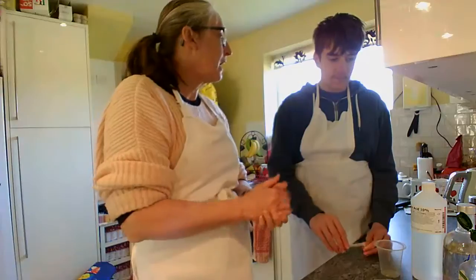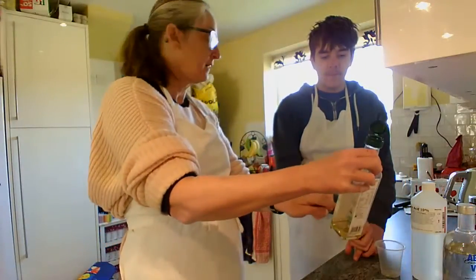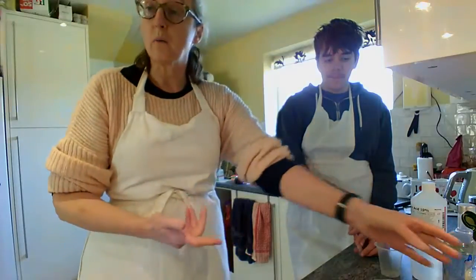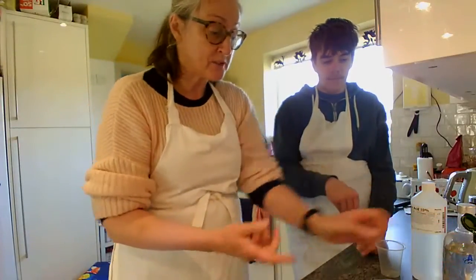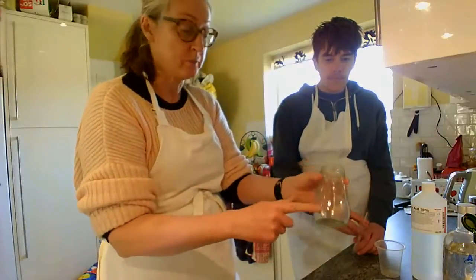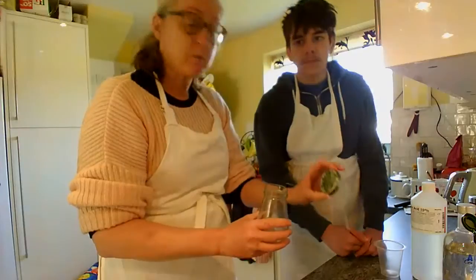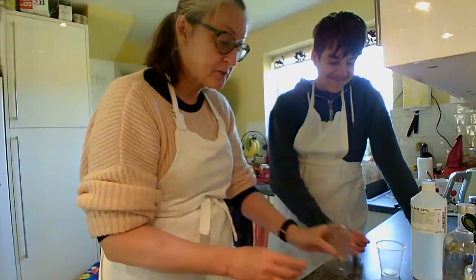And our carboxylic acid that we're using is ethanoic acid, which is obviously vinegar. We're using white wine vinegar. We haven't got much of it left, as you can see, so we're somewhat limited by that. This is our conical flask, as you know from past videos that we've made. If you've watched any of the others, we obviously buy these made with real fruit inside from the supermarket shelves.